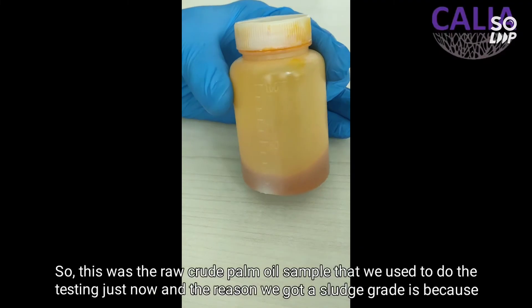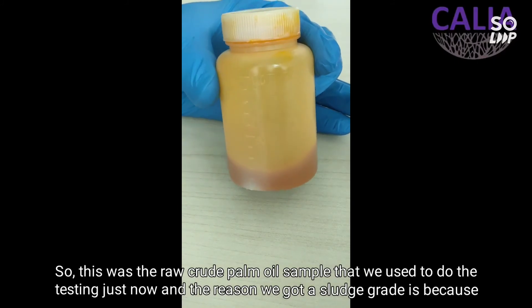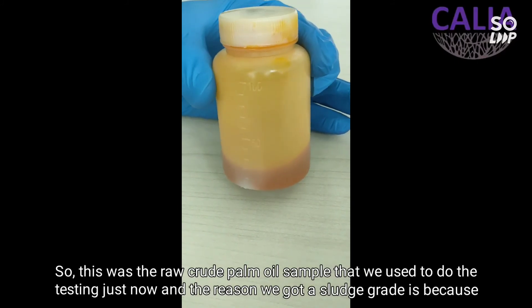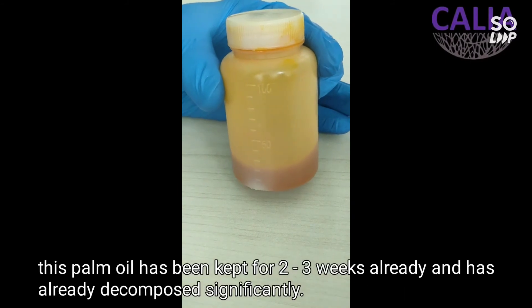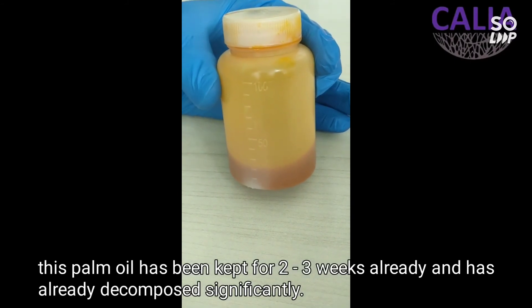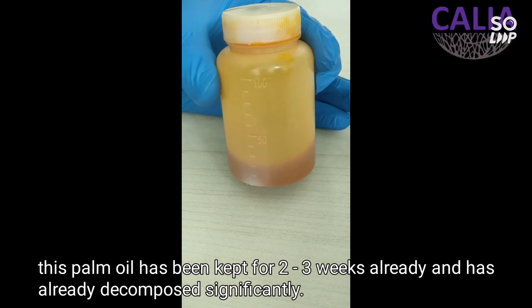This was the raw crude palm oil sample that we used to do the testing just now, and the reason we got a sludge grade is because this palm oil has been kept for 2 to 3 weeks already and has already decomposed significantly.